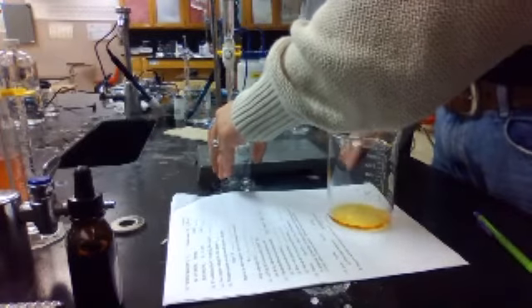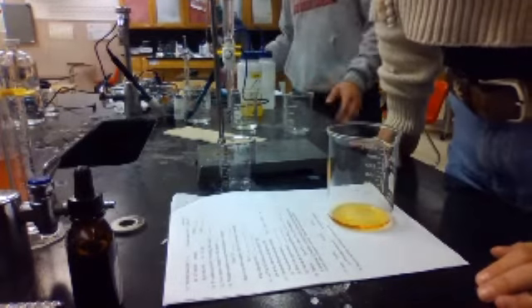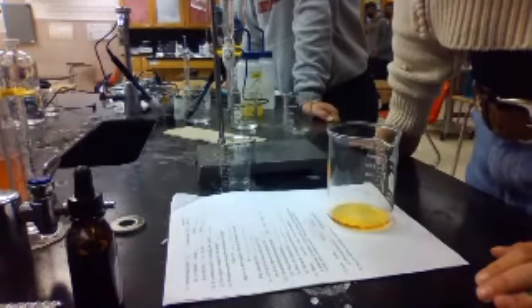We give them the pH. Okay, that looks 0.99. All right. Okay, and then the initial volume of the base. It's like 0.19, maybe. Each of these is 0.1. That's why this instrument's so expensive. Right down here would be 0.99, almost to the 1. Oh, okay. So 0.19. Okay. So the initial volume of the base is 0.19.